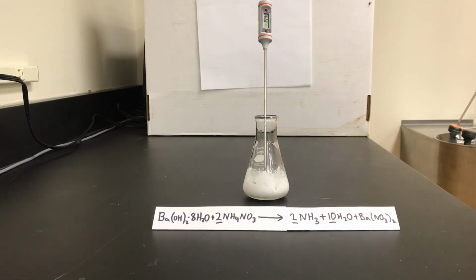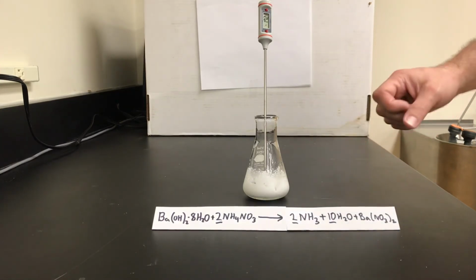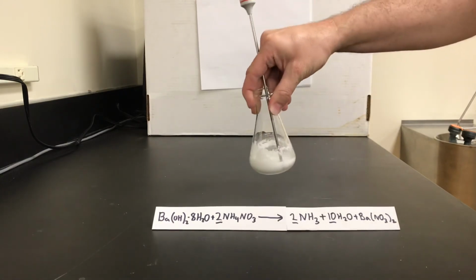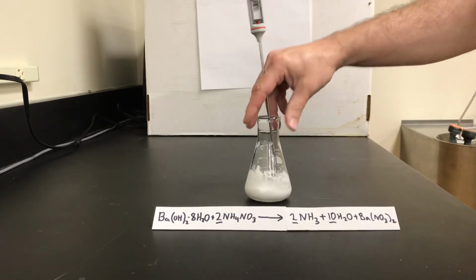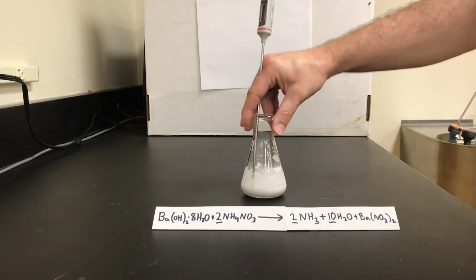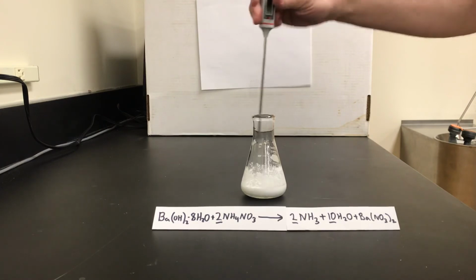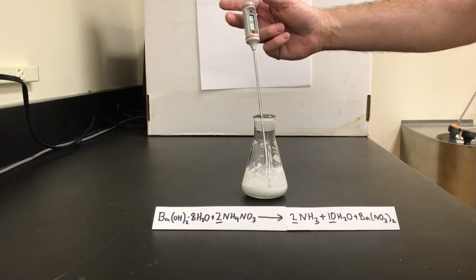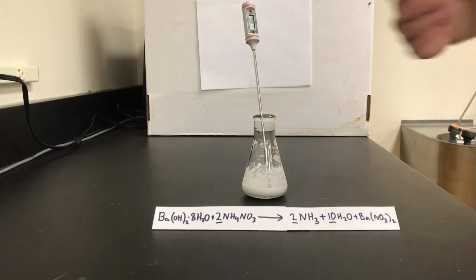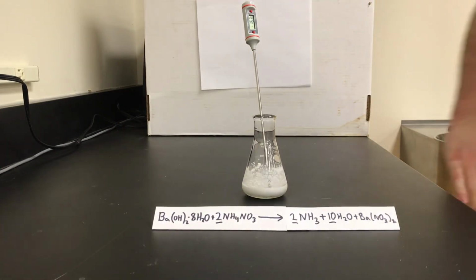This reaction also produces water, which of course is going to form in here. At first it is a liquid, and in some places in the flask you can see some of this liquid water. If I stir it around now, you can certainly see the liquid forming. The reason it's a liquid, even though the temperature is currently about -16.6 degrees, is that we have an effect going on called the freezing point depression effect.